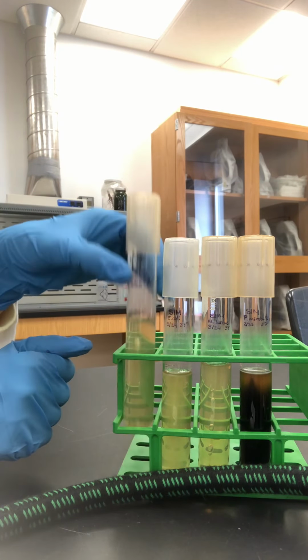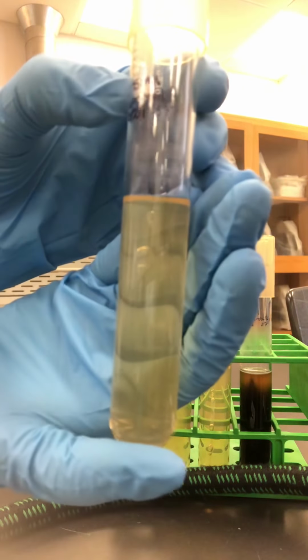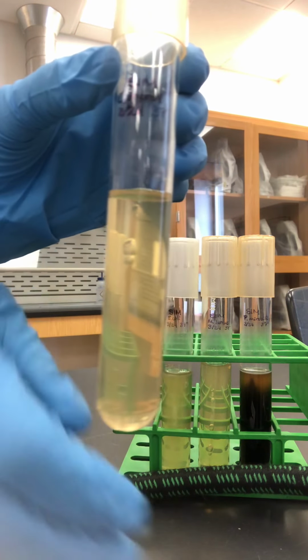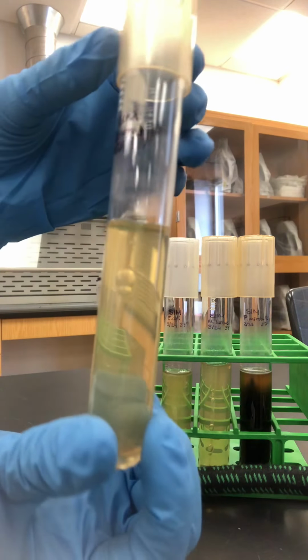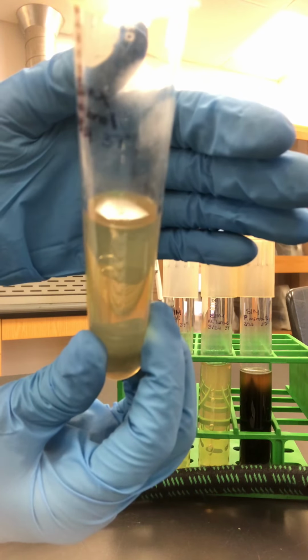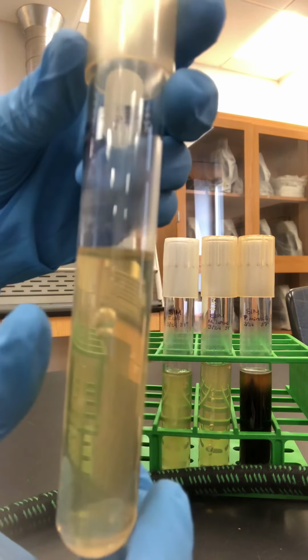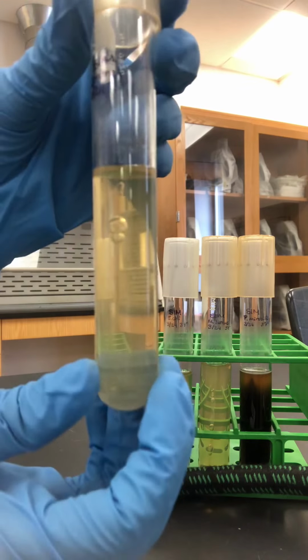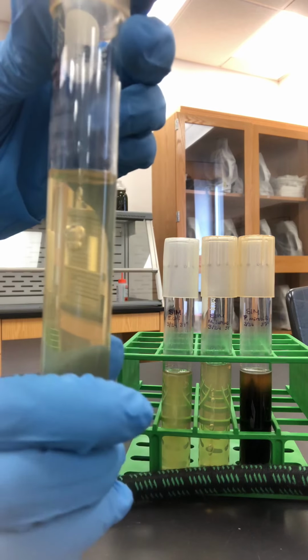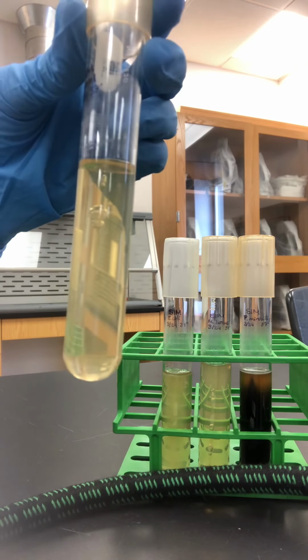So let's look first at our control. We can see that there's some bubbles around where our stab was. Remember that we inoculated these just with a needle. But there's no growth to be seen on the top there. It's all clear. There's nothing growing on the top. I can't see anything inside the stab, which means that this control was good. We're going to use this to compare with motility, since this has no turbidity. So we can compare that to our other tubes to see if they had motility.